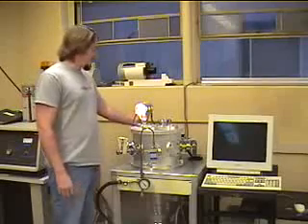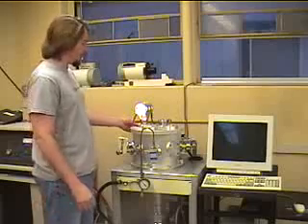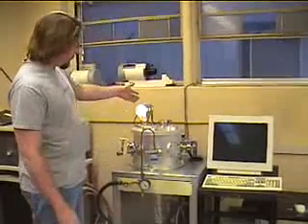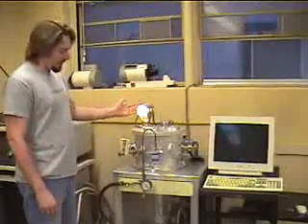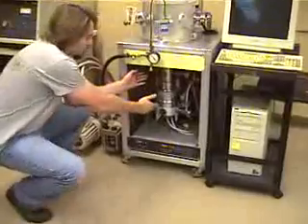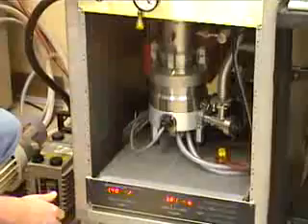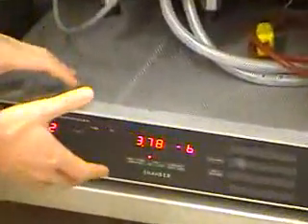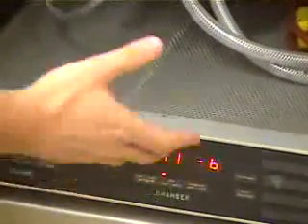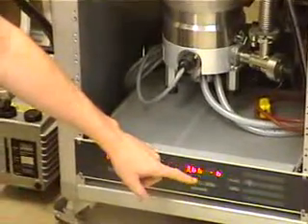The residual gas analyzer is hooked into this vacuum chamber, which is necessary for the gas analyzer's proper operation. At the top here, we have an ionization pressure gauge, and down here at the bottom we have a turbomolecular pump, which maintains the vacuum inside the vacuum chamber. The ionization pressure gauge tells you what the pressure is inside the chamber, and all of this is controlled by the vacuum process controller, which you see right down here. Before you can begin your experiment, you need to make sure that this number reads on the order of 10 to the minus 7th torr.